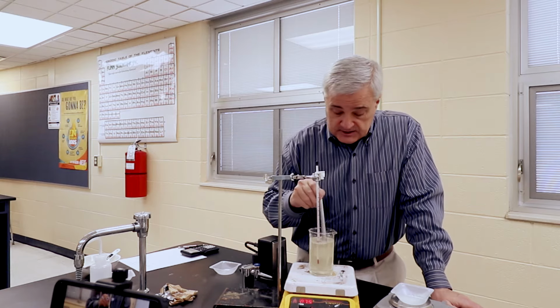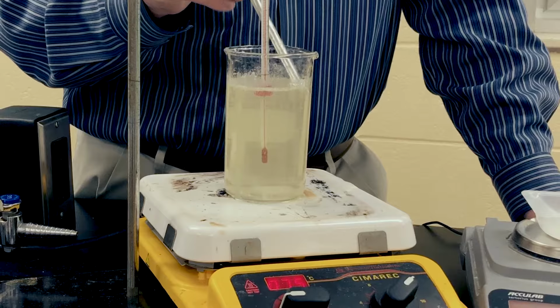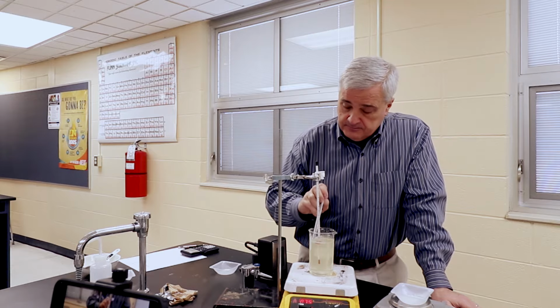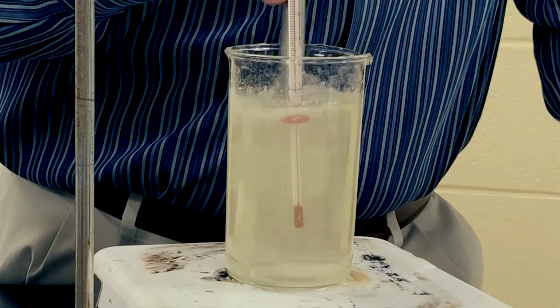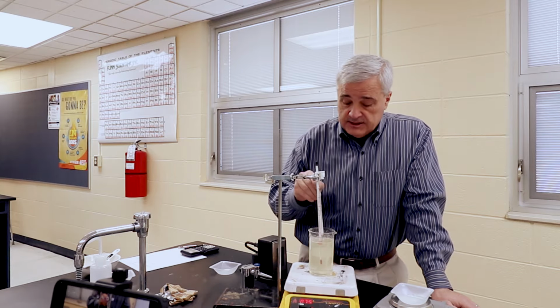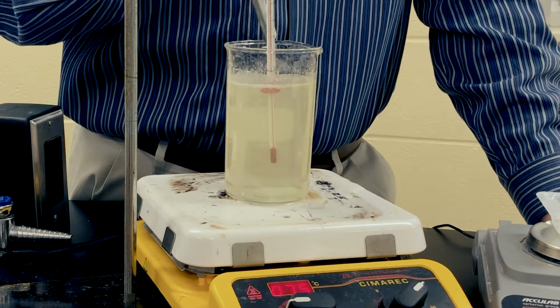This will be 1.06 if it will go in. I've also started getting a buildup on the side from where I have stirred with the spatula. So there are some crystals of sugar on the side of the beaker. Again, we're not making medicine. Like I said, it's almost like we're making candy without the ability to actually eat it, because you do not consume things from a chemistry lab, even if it's just sugar and distilled water.